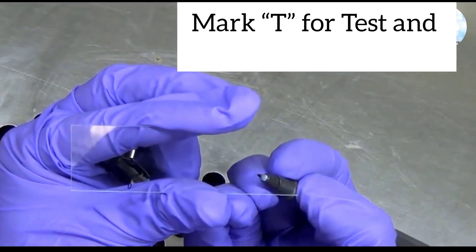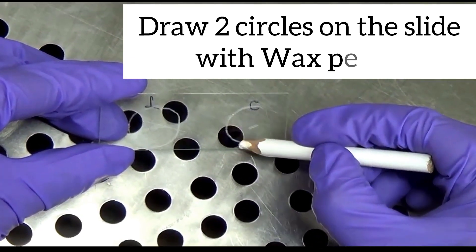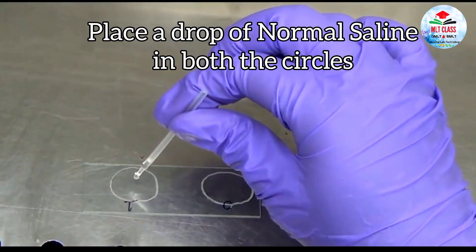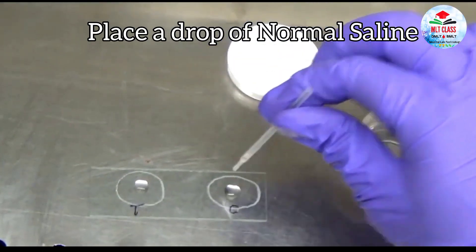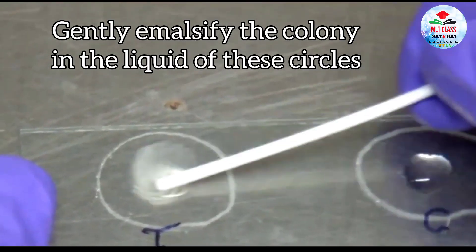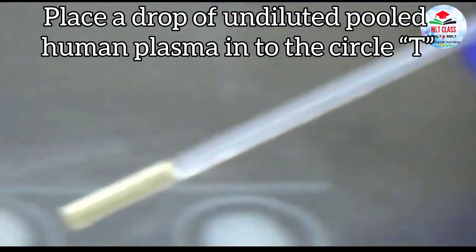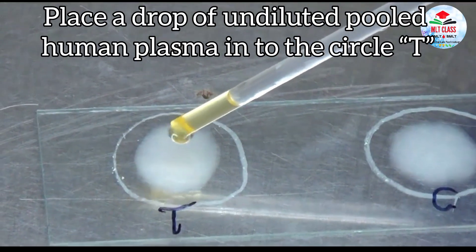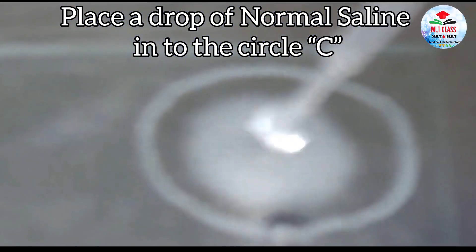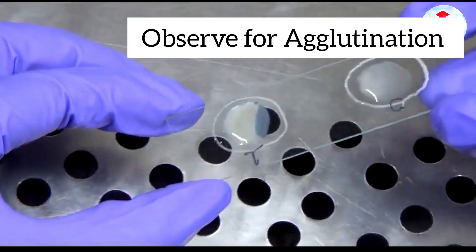Take a clean glass slide. Mark T for test and C for control. Draw two circles on the slide with a wax pencil. Place a drop of normal saline on both circles. With the help of an applicator stick, take the colonies and gently emulsify the colony in the liquid of these circles. Place a drop of undiluted pooled human plasma into circle T, and a drop of normal saline into circle C. Rock the slide and observe for agglutination.